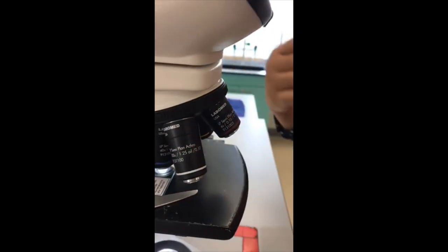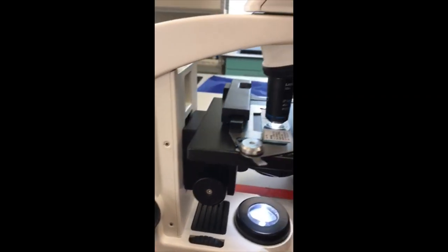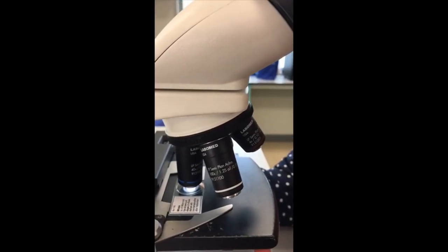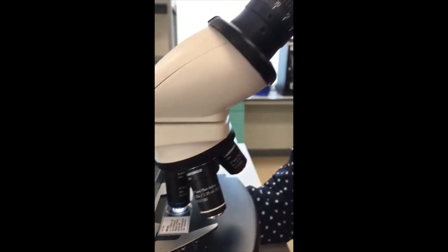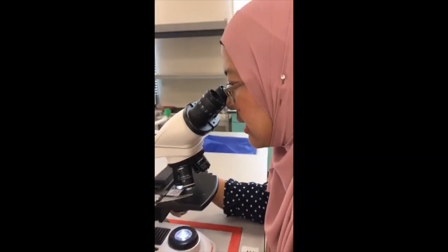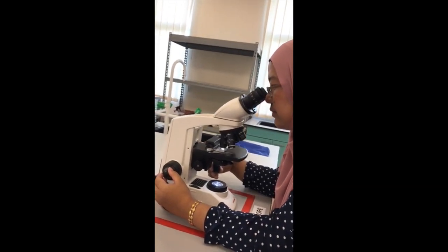Now you need to use the fine knob to look at your specimen. Now I can see very sharply all the stages of mitosis. I can see the metaphase stage in this Allium species. I can also see the stage of prophase and also telophase.